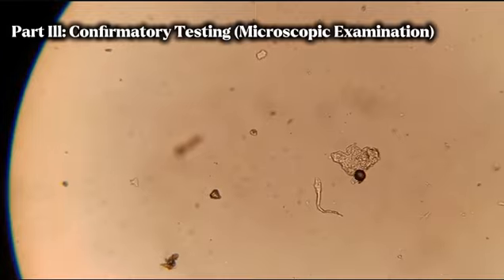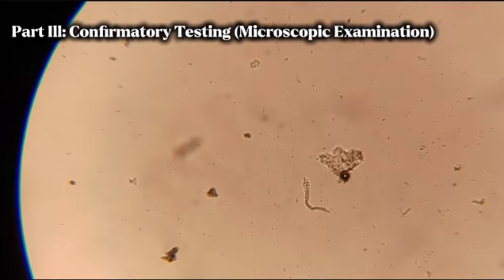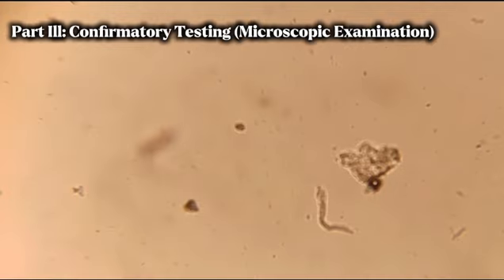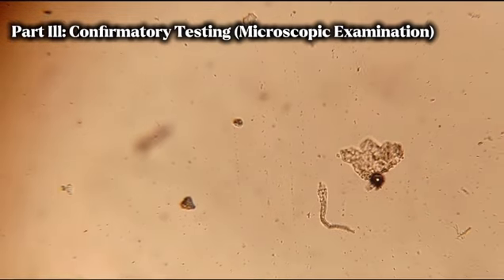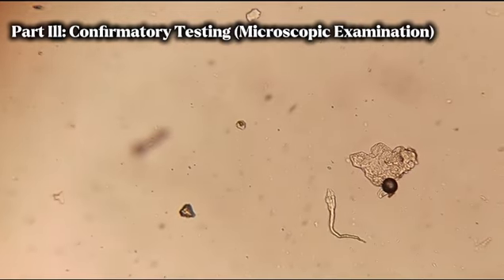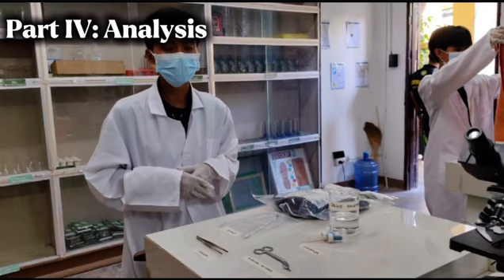This is the appearance of the sample under a microscope. As we can see, we have the head and the tail of a sperm separate from each other. Now we proceed to part 4, the analysis.